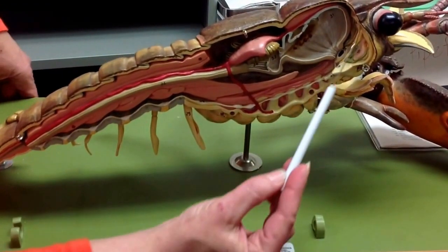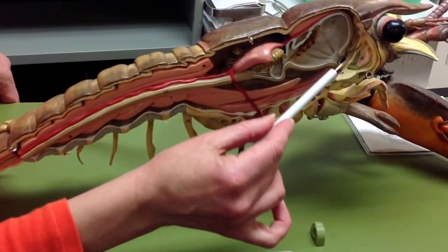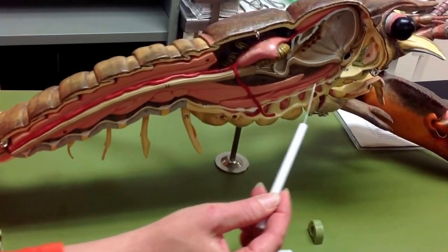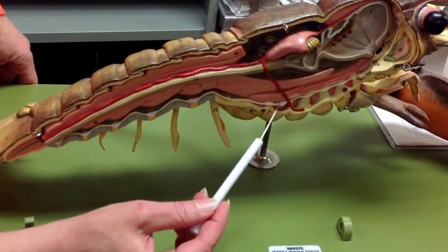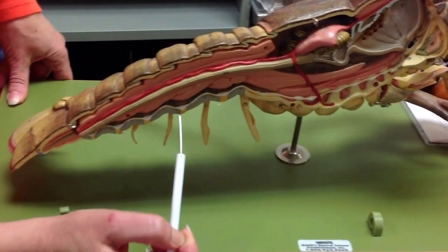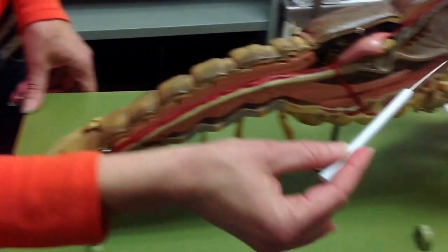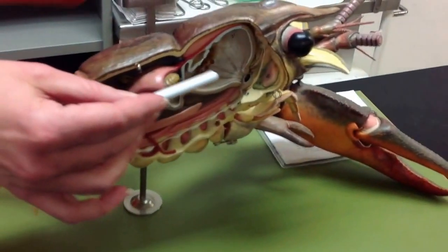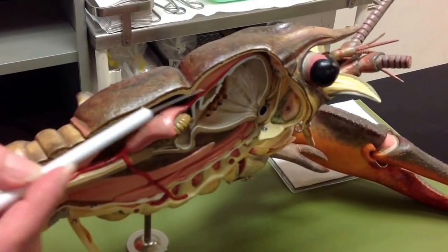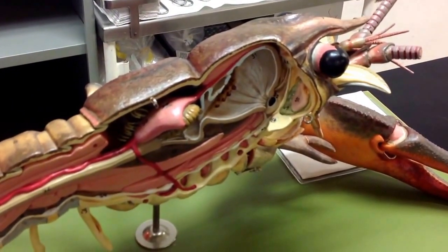The nervous system has the supraesophageal ganglion up here. Down here is the subesophageal ganglion leading into the ventral nerve cord with ventral nerve ganglion bundles along its length. Up here at the base of the antenna, you have the green gland that ends in an excretory pore that releases urine at the base of the antenna.